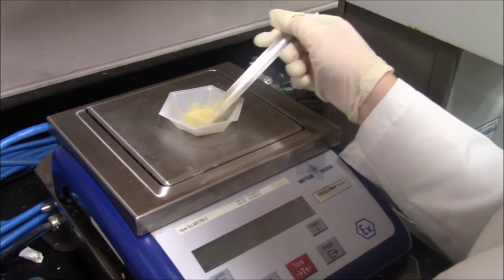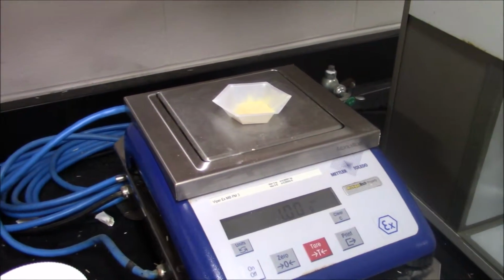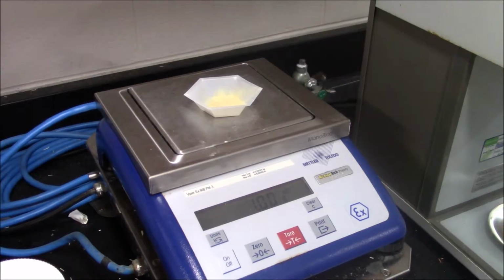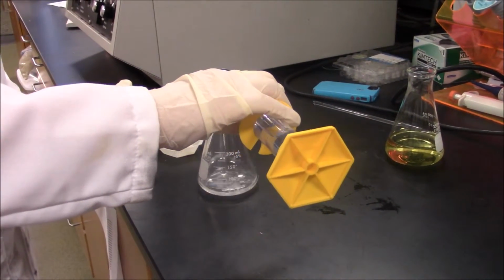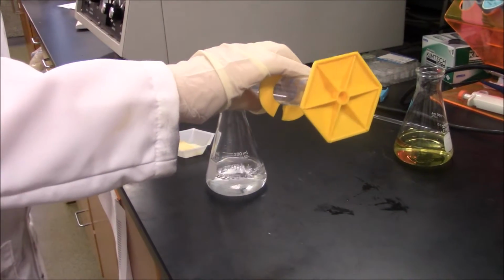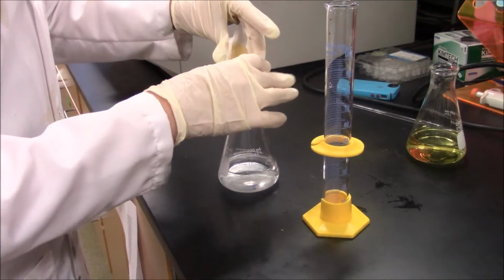A buffer solution, which will be used to dilute samples taken during fermentation so that they can be accurately measured by glucose meter, should be made. This solution will contain all chemicals in the fermentation solution, except for glucose, which is the independent variable.